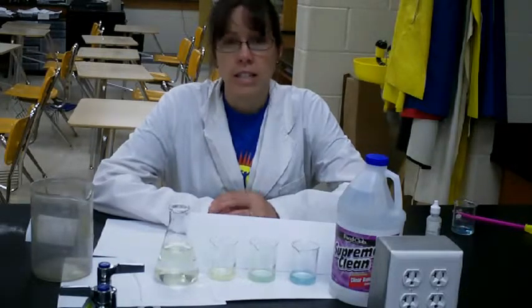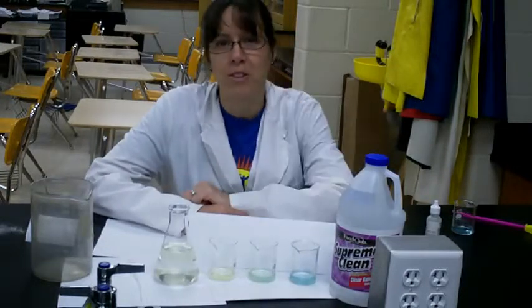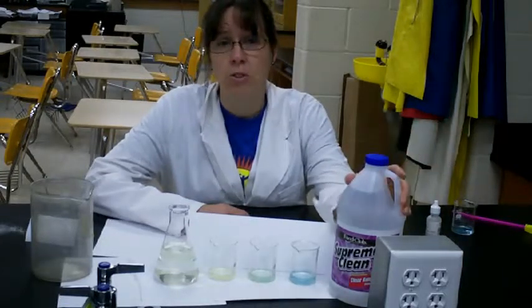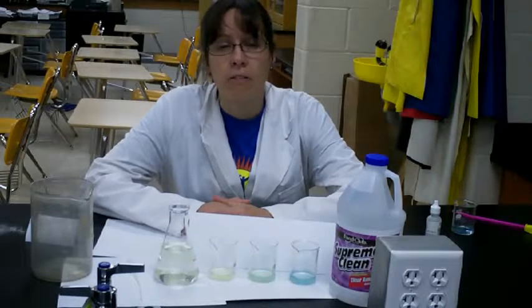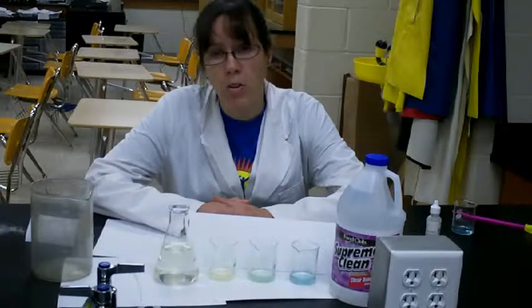And for this, you're going to need an ammonia stock solution for your class. And I found the most difficult part of this was actually finding ammonia that didn't have some pretty color in it. So after looking for a while, I did find plain white ammonia, and I followed the recommendations in the teacher's guide of diluting it 1 part ammonia to 25 parts water.